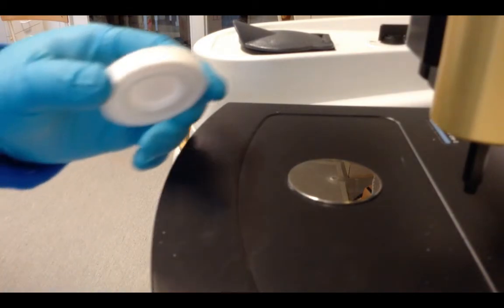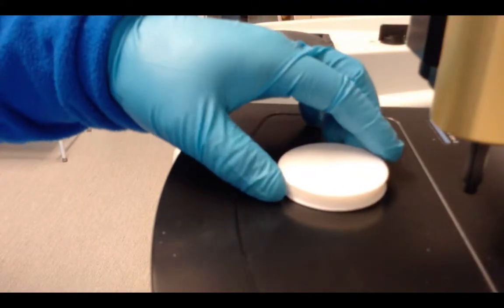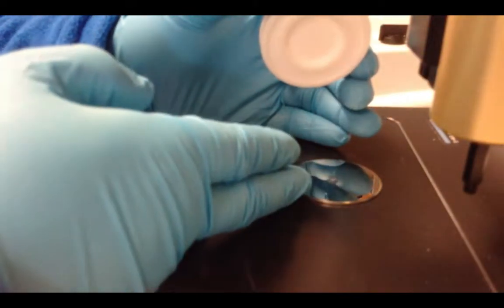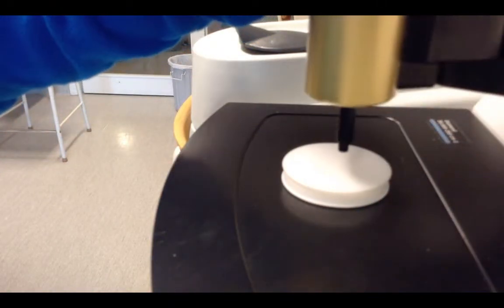To do a liquid sample, you need an extra plastic cover like this. It can be just mounted on this metal ring so that you can put your liquid on a diamond.